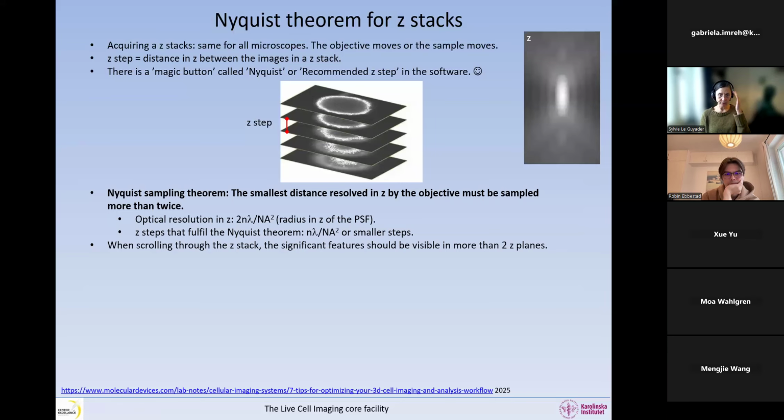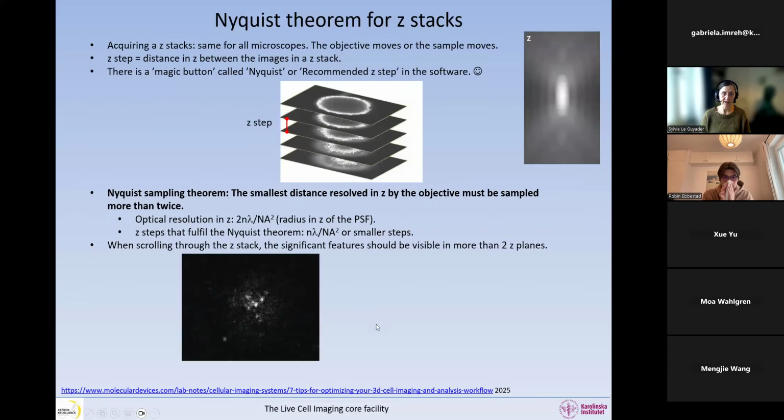So when scrolling through a Z stack, how do we choose the Z step that works for us? We have to think, related to the scientific question, what is the significant feature in my image that I want to record reliably? This feature should be visible in more than 2 Z planes for you to sample correctly. So here is a correctly sampled nucleus with dots inside. If you look at any of the dots, you will see that they appear in several images, more than 2 images.